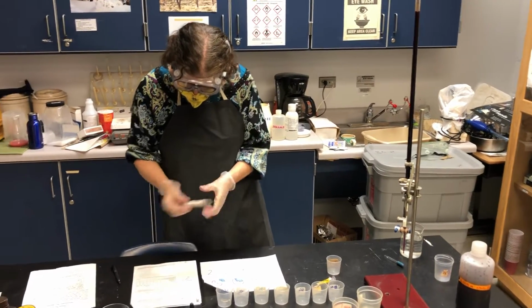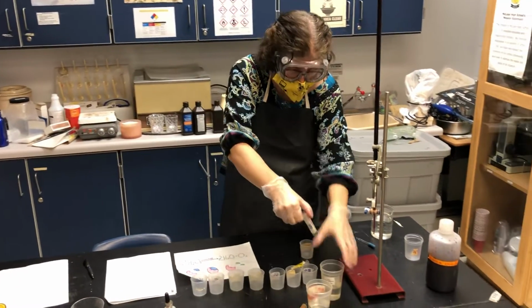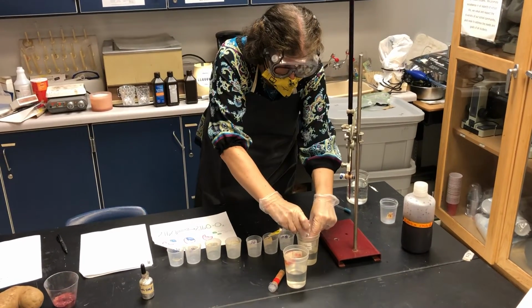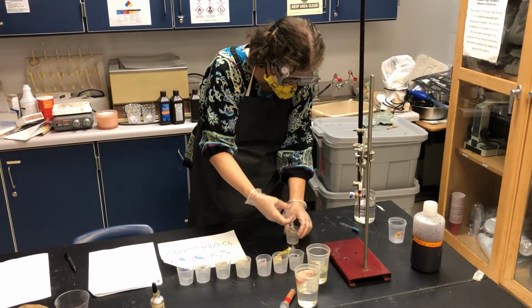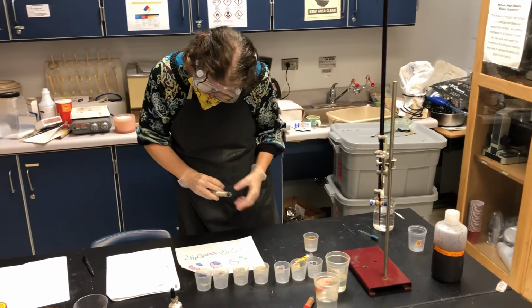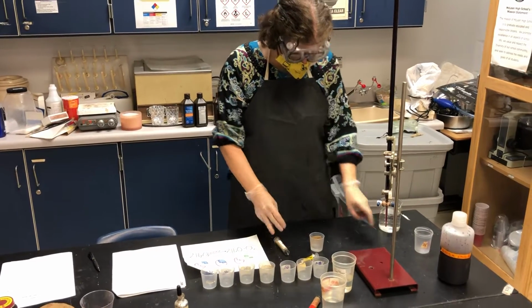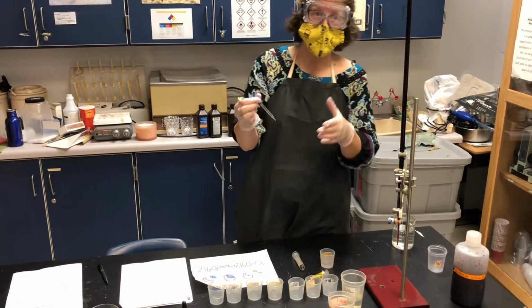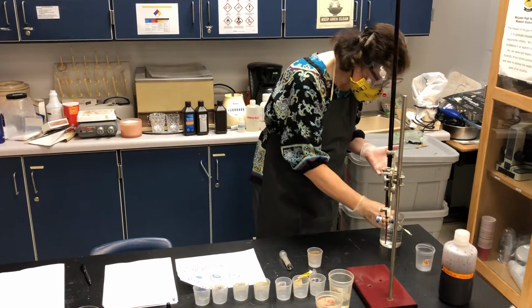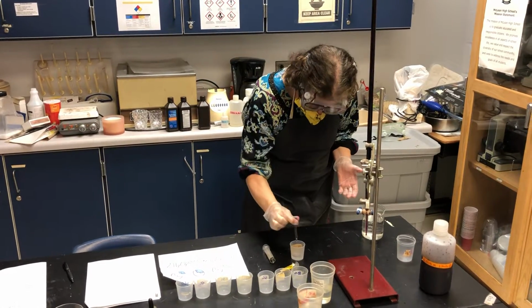Okay, so the first thing I'm going to do is make a baseline cup. I'm going to take 10 mils of my hydrogen peroxide, pull it up right in here, and put that in my first cup. And then I'm going to use this as a control. At this point, I would be adding catalase enzyme, but since this is my control, I'm going to replace it with distilled water. I'm just going to put it in there and pretend that's enzyme.